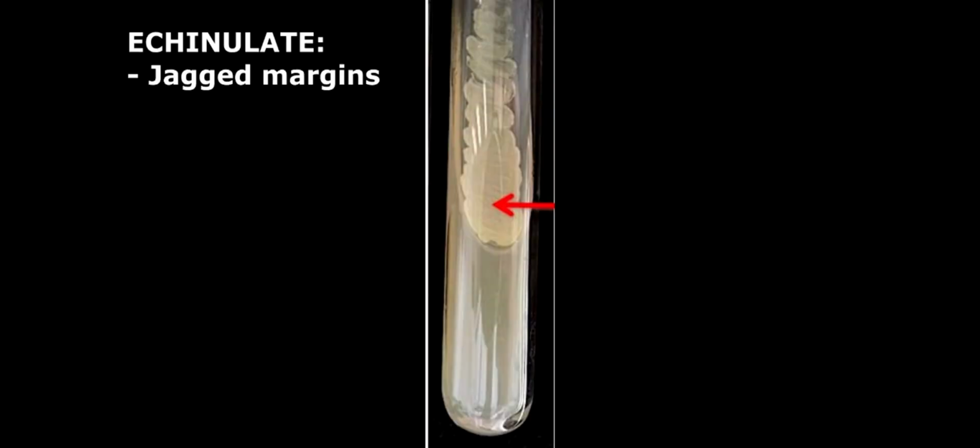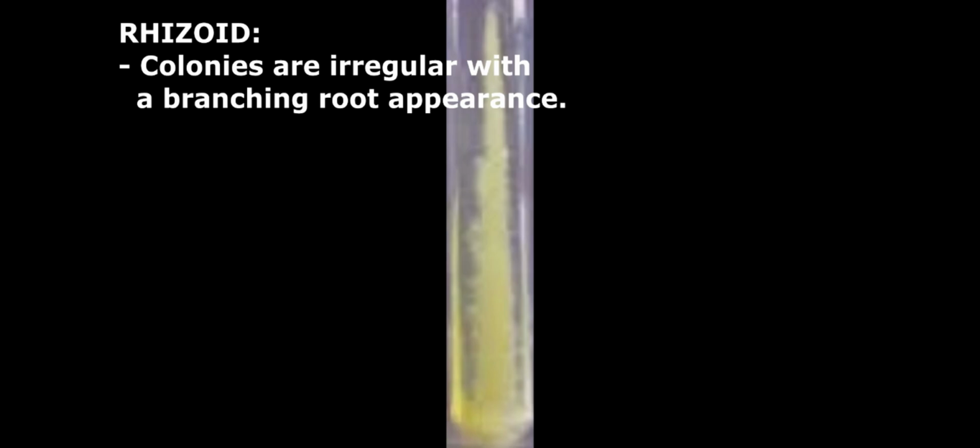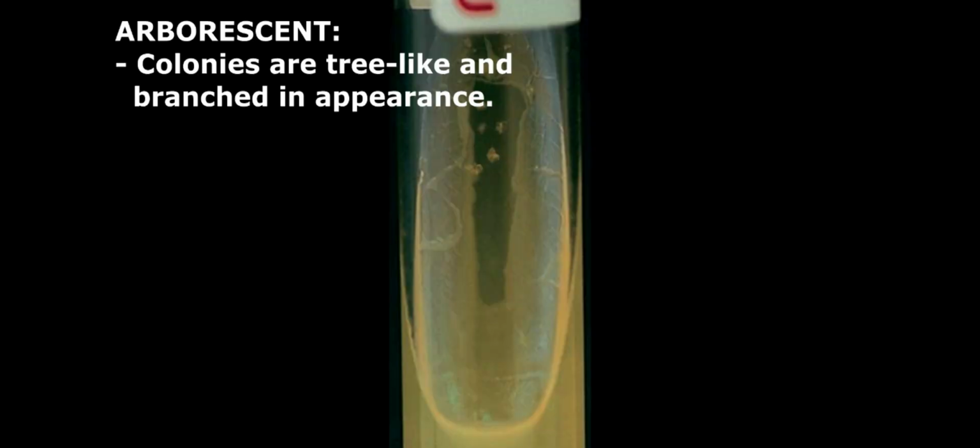For echinulate, it has jagged margins. For beaded, there are separate or confluent colonies along the line of inoculation. For rhizoid, the colonies are irregular with a branching, root-like appearance. For arborescent, the colonies have a tree-like, branched appearance.